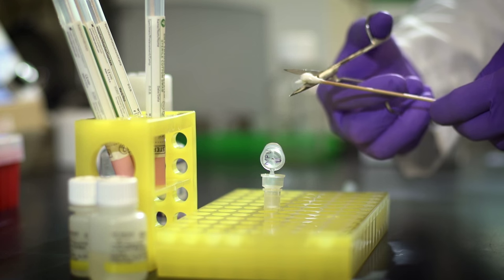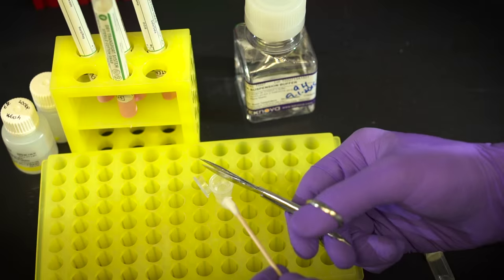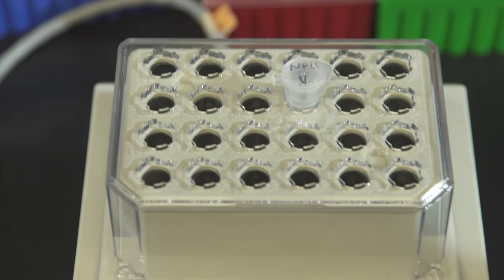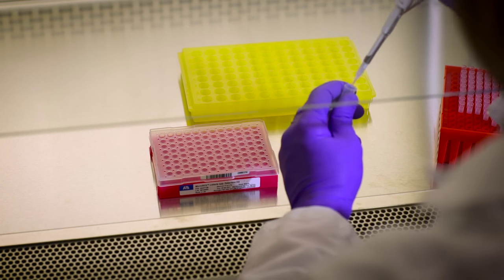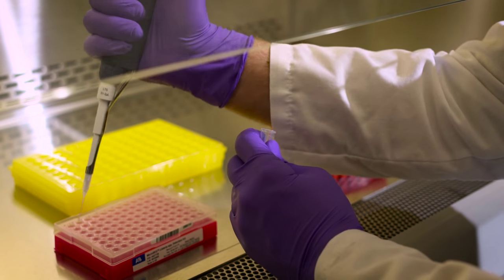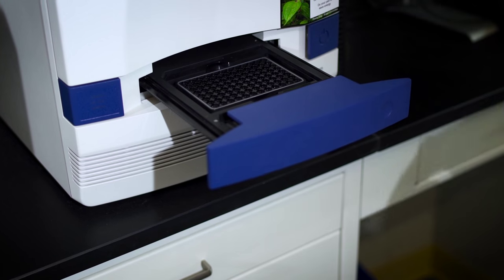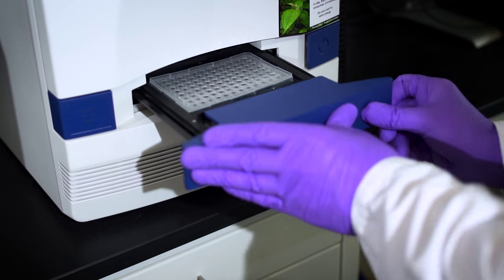Let's demonstrate the protocol. Cut off a small piece of cotton swab sample and save the rest of the swab for differential extraction. Place the swab cutting in a heated sperm lysis buffer column for 10 minutes. Centrifuge the column and then add neutralizing solution and perform simple dilution of sample in Tris EDTA. Add two microliters of lysate into the Quantifiler Trio real-time PCR reaction and use the standard protocol for the trio.